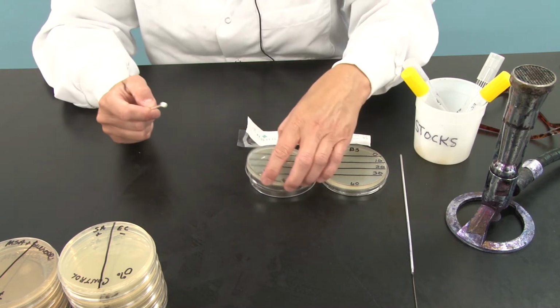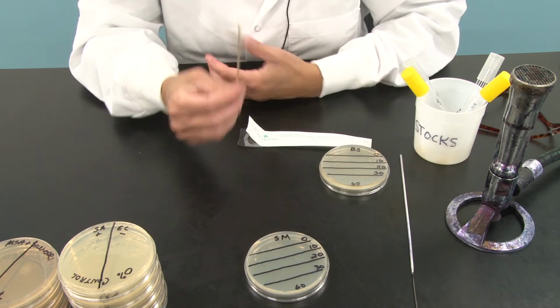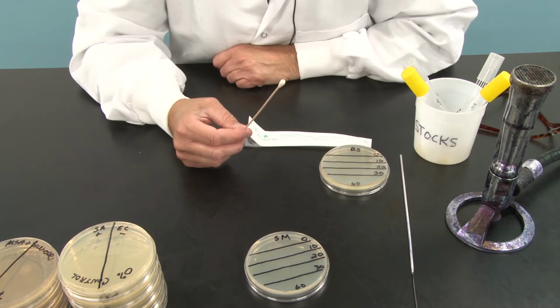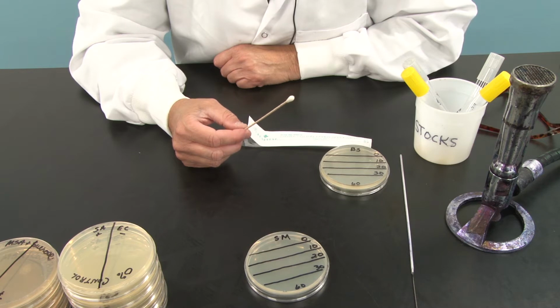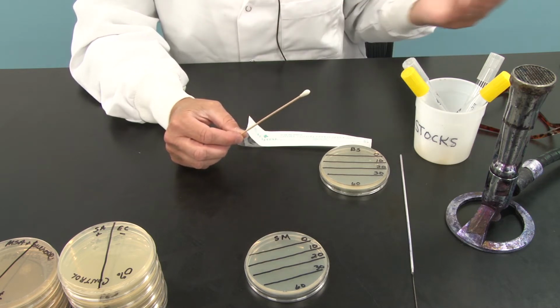All right. So that's Serratia marcescens. I'm going to move that out of the way. Question is, what do I do with this? I have to ask you guys something. In healthcare, do you ever re-sleeve anything? Needle swabs, do you ever re-sleeve? No. So this needs to go in the disposal.